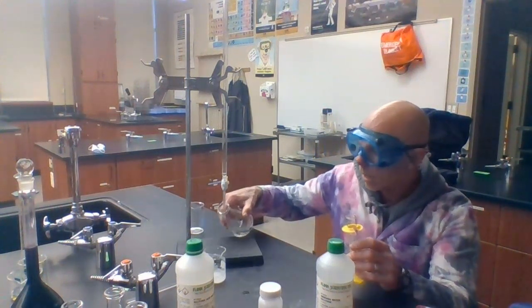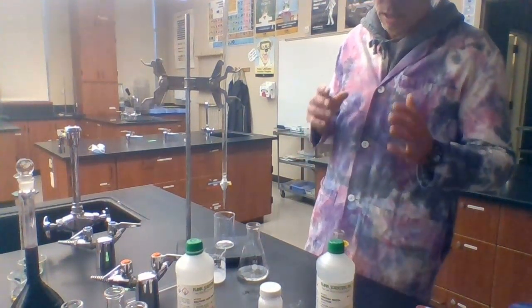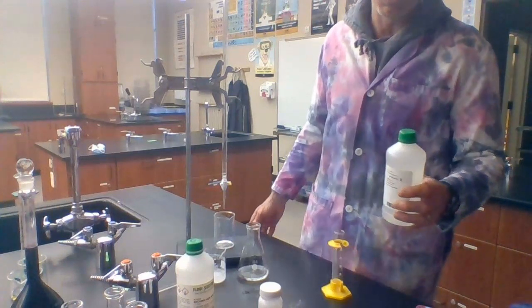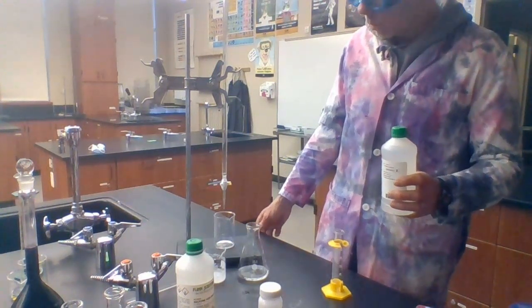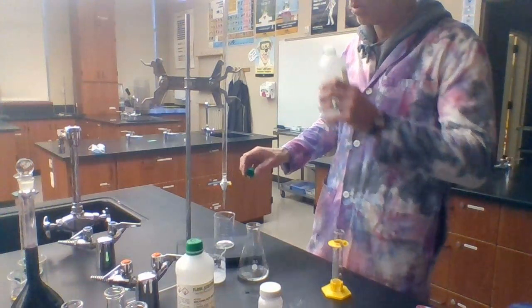The value you're going to want to write down is 20.0 milliliters of sulfuric acid. The next thing I'm going to do is fill the burette with the titrant — the solution whose concentration is known. In this case that's the ammonium hydroxide, and the concentration is known to be 0.20 molar. That's something you should write down as well. So I'm going to fill it with the funnel. I've got my stopcock closed — it's perpendicular to the burette so it won't spill out.